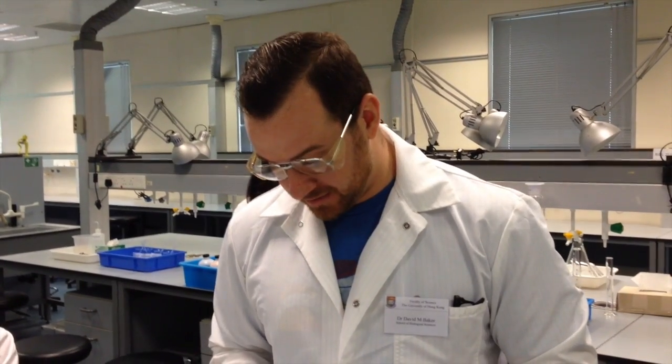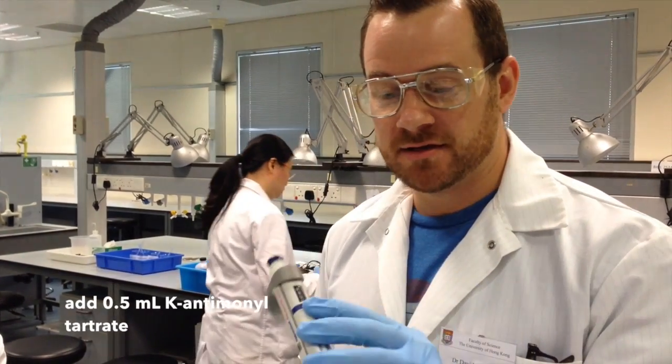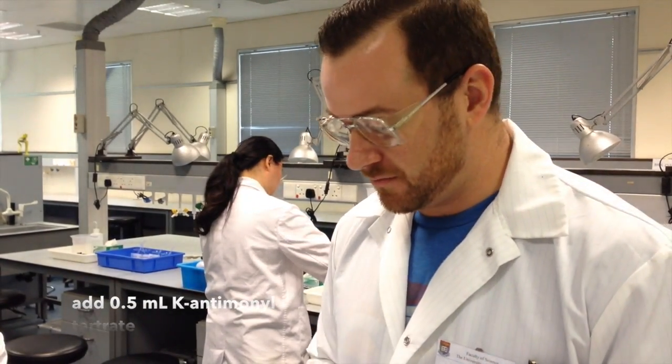The next step is to add 0.5 milliliters of the potassium antimonyl tartrate solution. So I'm going to change the setting of my pipette to 500, which is 0.5 milliliters.